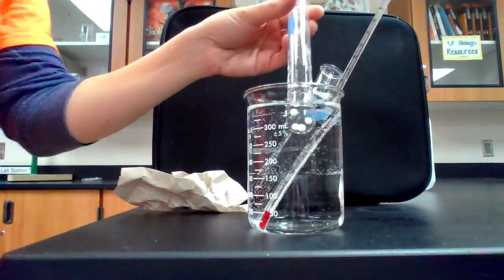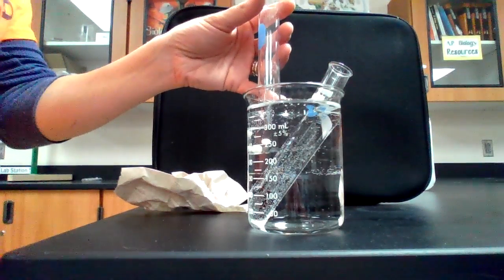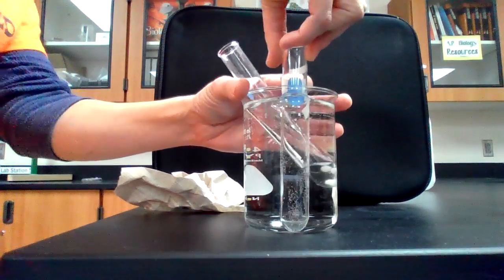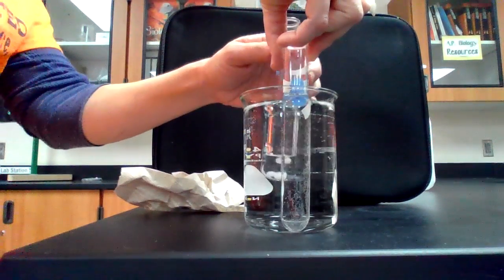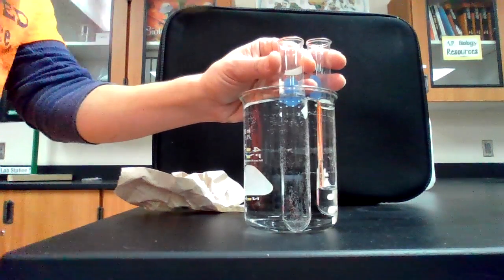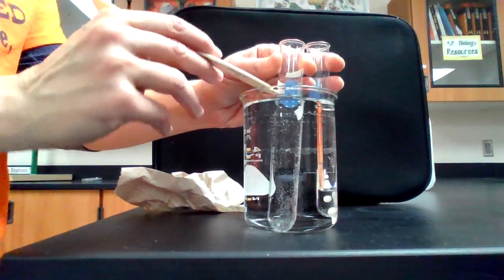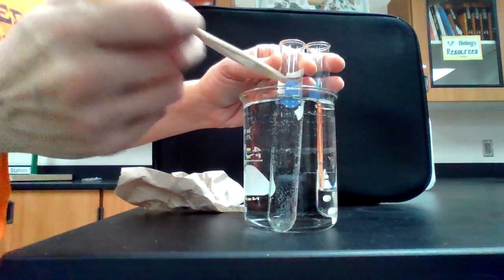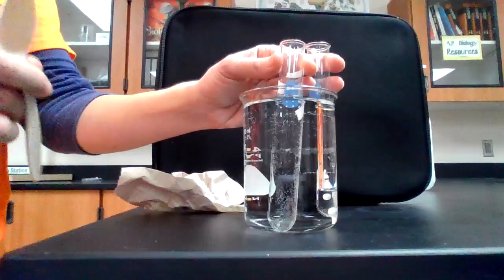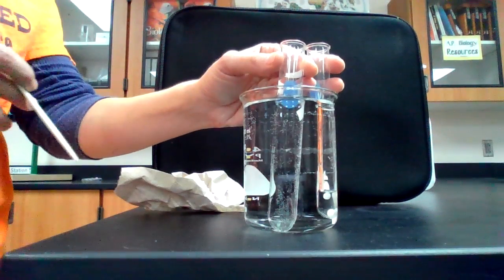So I am going to keep these in here as much as possible. I'll remove the thermometer just so it's easier for you to see. I will be holding the hydrogen peroxide test tube right up against the side like this as I drop the yeast spheres into it. So you will need a timer as you watch this. You can either start timing as soon as the yeast sphere hits the top of the hydrogen peroxide and time it from there all the way to the bottom and then till it gets back to the top. Or you can start your timer right when it hits the bottom and stop when it hits the top.